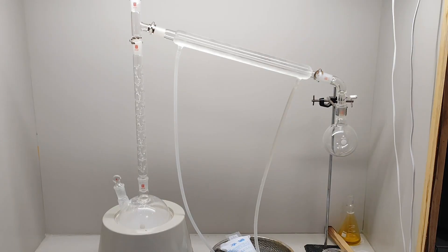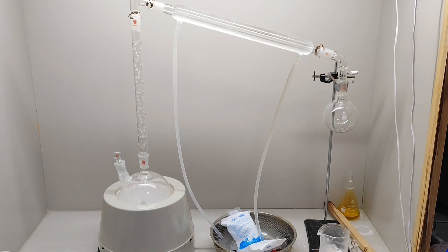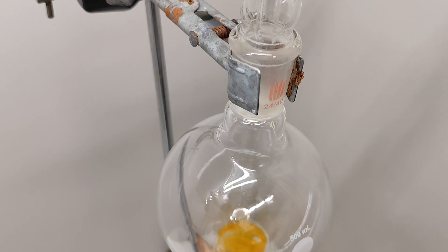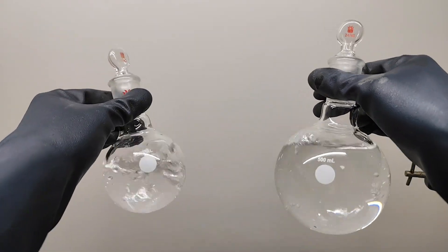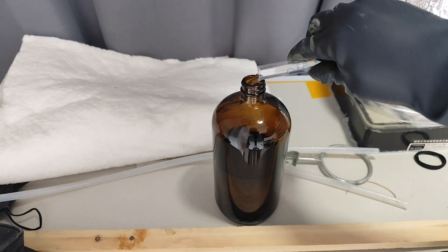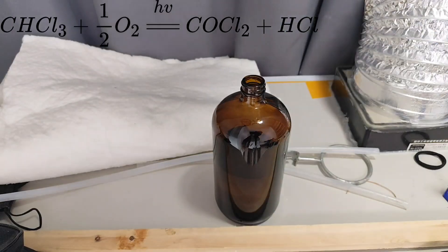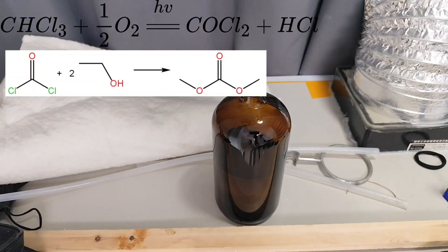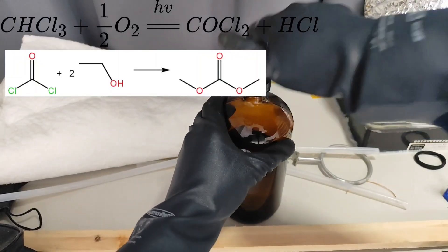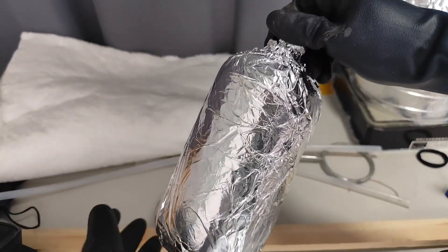The next day, to obtain the chloroform, I perform a fractional distillation. Some nice, clean liquid collects in the receiving flask. I obtained about 600 mL of pure chloroform, all stored in a brown bottle. To stabilize it, some ethanol is added, because chloroform reacts with oxygen in the presence of light to form extremely toxic phosgene gas. The ethanol reacts with any phosgene formed and protects against exposure when opening the bottle. Aluminum foil is also wrapped around the outside to keep out light.